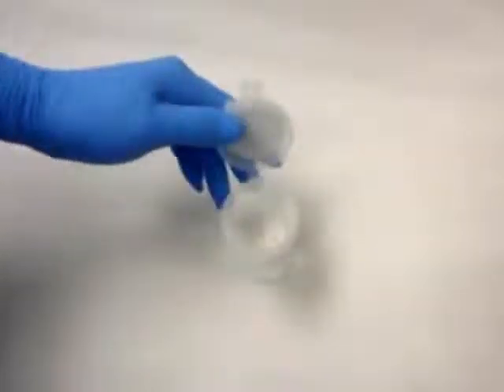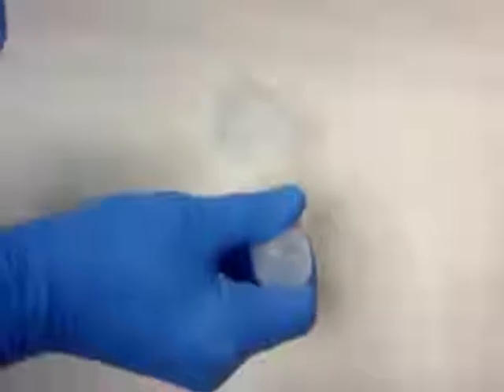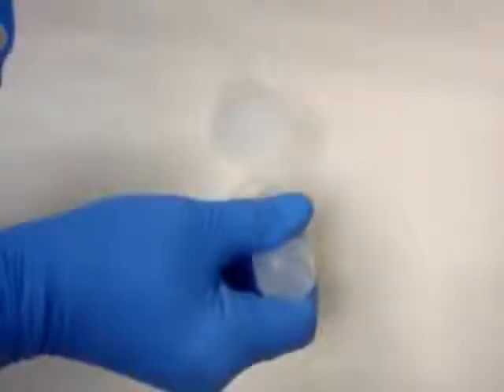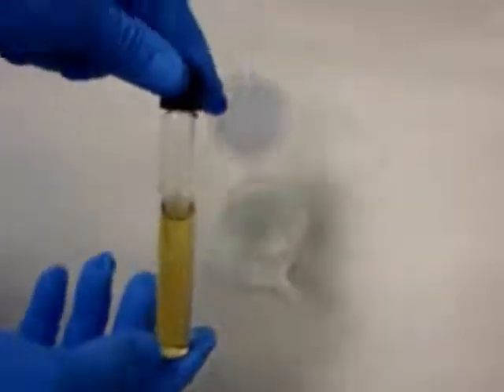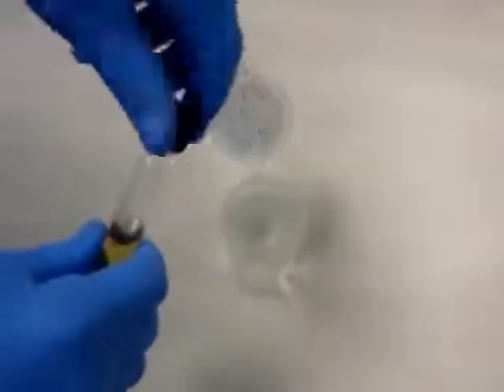For this demonstration, we'll be using a liquid sample. First, collect your 100 ml sample and add 4 drops of reagent B, the enzyme inducer. If you need to detect less than 1000 CFU, then you will want to perform the short 5-hour incubation step at this point, which requires the addition of the growth media specified in the product insert. Otherwise, you can skip the incubation step.